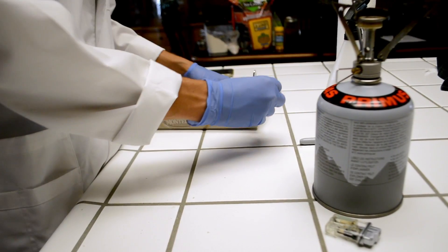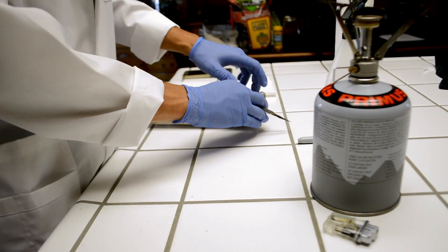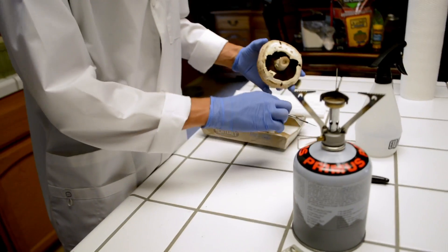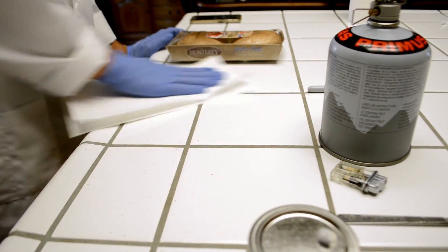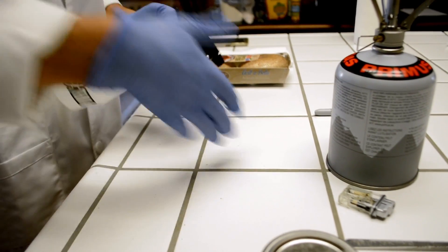We will start with fresh tissue culture. This involves taking the cleanest piece from the inside of a mushroom body and placing it onto our agar. Once you have a fresh mushroom in hand, take all the necessary precautions and sterilize your workspace, whether that be a countertop, workbench, or glove box — not neglecting to sterilize yourself as well as any tools you will use.